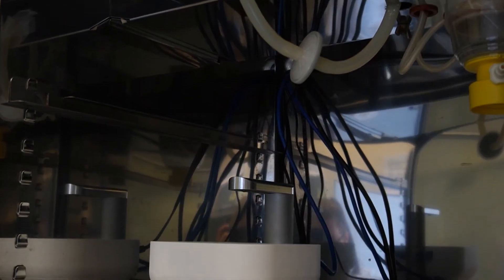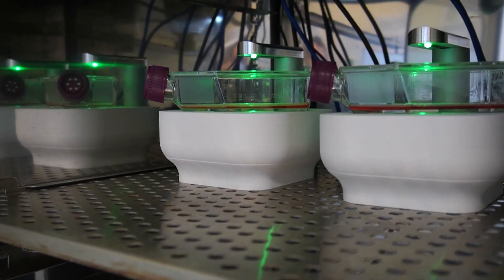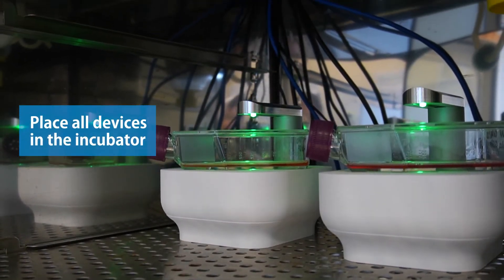Performing experiments with these Lux3FL kits is straightforward. Simply place all devices next to each other in the incubator for the fairest comparison.